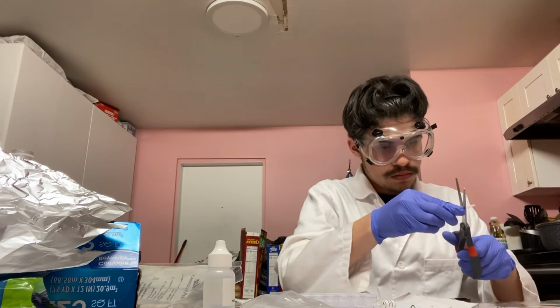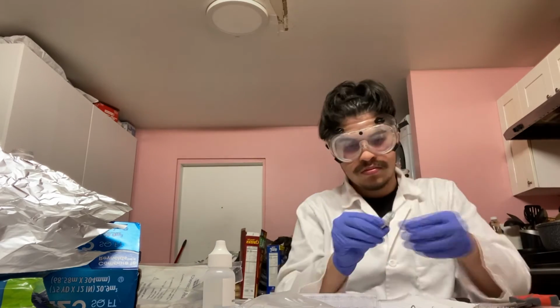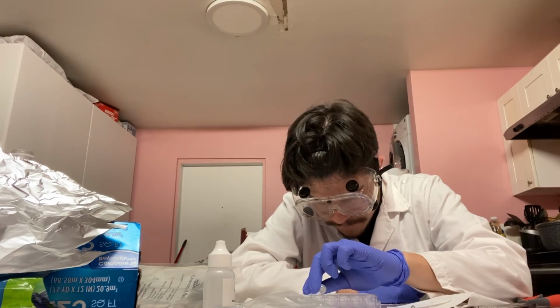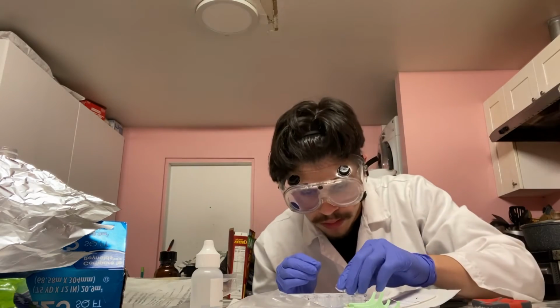In this part of the experiment, lots of observations are going to be made about the chemical reactions occurring. The pipettes have labels that will guide you by letting you know what to use for a chemical reaction. The chart provided gives us the information on what chemicals to mix. 2 different compounds will be mixed for each chemical reaction. For each compound poured, about 3 to 4 drops is sufficient to cause the chemical reaction.